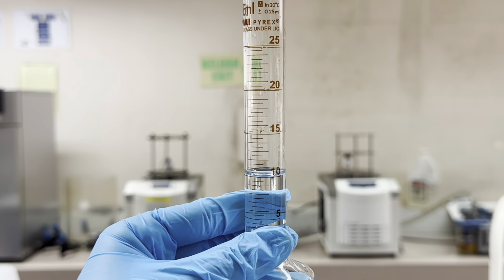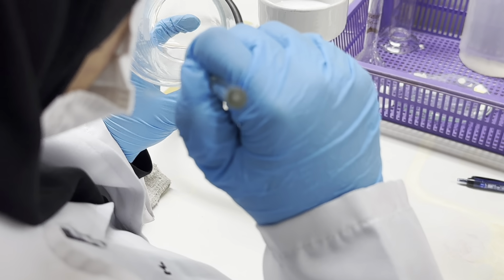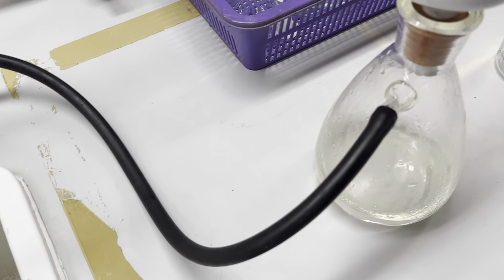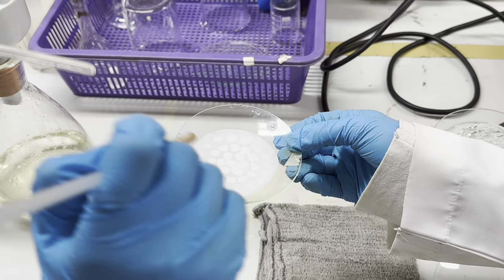Add 10 ml ice-cold water to rinse the beaker. Use a rubber policeman to help transfer the remaining solid to the funnel. Repeat these steps until all the precipitate has been transferred. Dry the precipitate with aspirator suction for 1 minute. Put the precipitate into a microwave oven and leave it to dry.